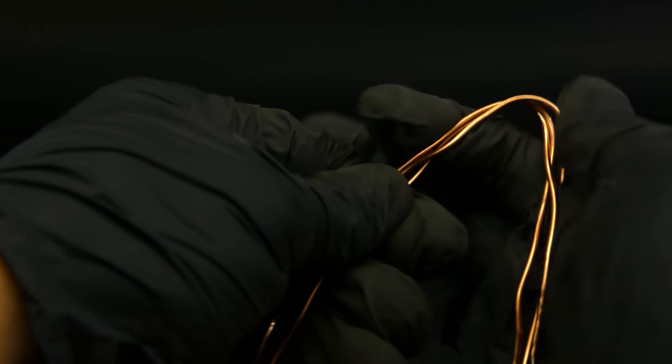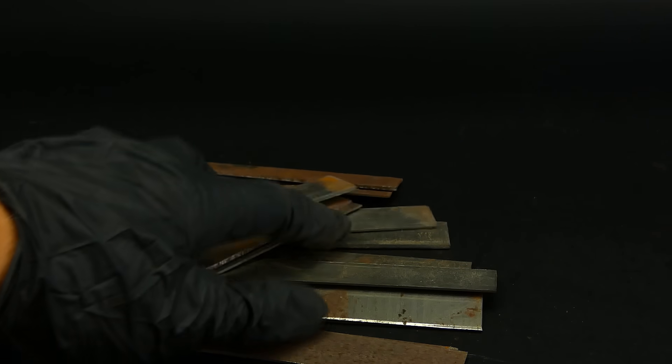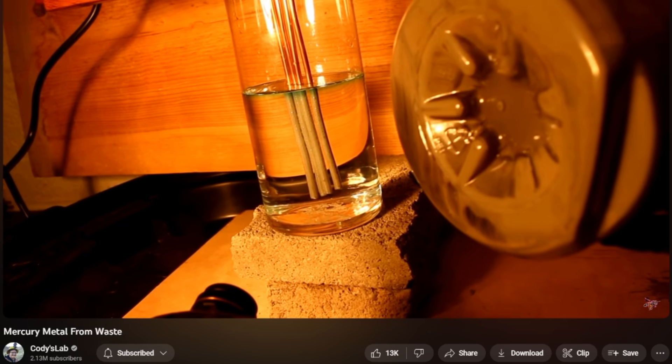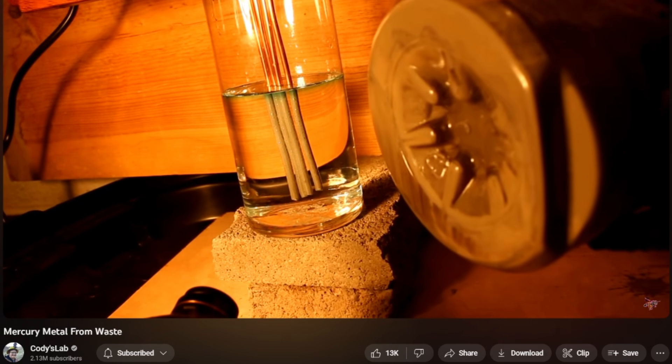You may wonder, why do I have to use copper? Because, for example, steel, which is mostly made out of iron, is also more reactive than mercury. It is also way cheaper and has the added benefit of being able to resist being amalgamated by the mercury, which is also a very useful thing that I will explain later. So steel might seem like the perfect candidate, but unfortunately, it is known to turn the mercury into this weird sand, which is a pain to deal with, and it is the reason why I can't use it.